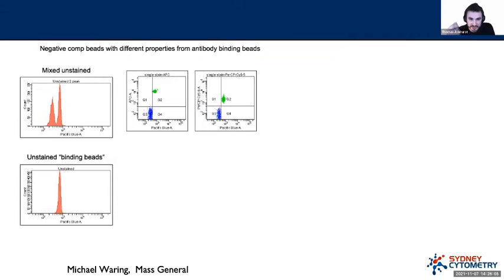The actual batch of the beads generated needs to be the same. This seems a little bit weird. You're like, well, why would it matter if the negative beads are made in a different batch of plastic from the positive beads? The reason for this is that the actual autofluorescence of the beads can change. And this matters a lot because if you have a look here, it's my little annotate button. There it is.